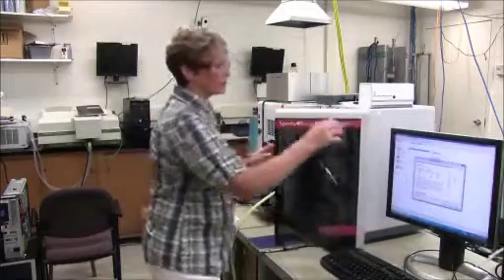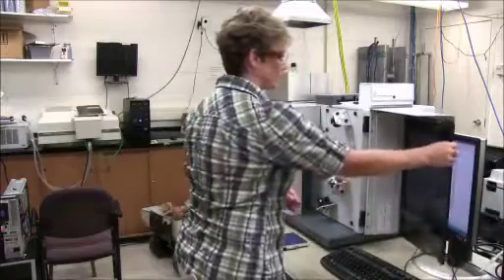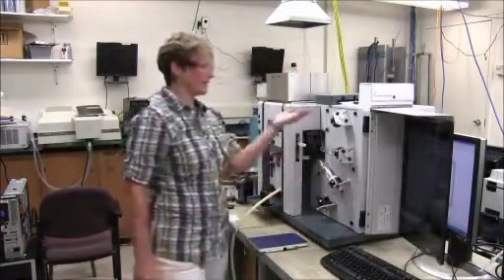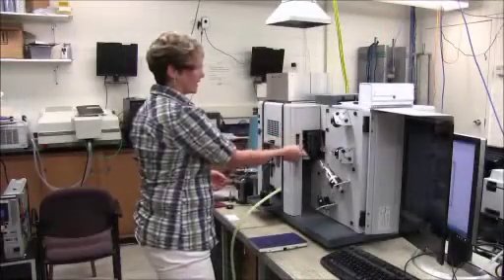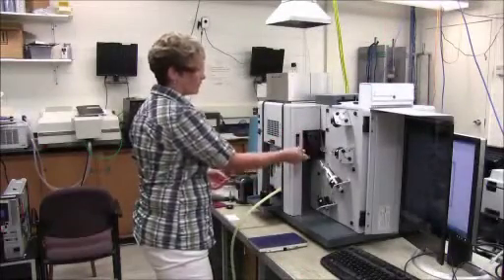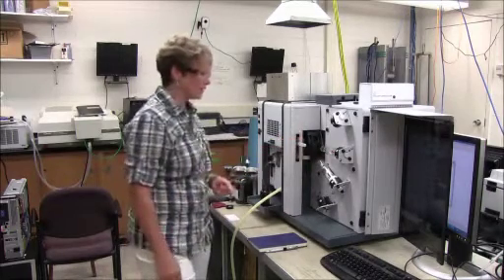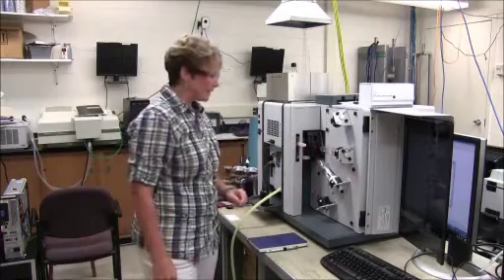For example, and I'll just move that aside so you can see the lamps. The Varian instrument, you're able to look at 4 different lamps at a time, not at once, but depending on where the lever is on this instrument, you can look at lamp 1, lamp 2, 3, and 4. Today we only have 2 that are installed in the instrument, a lead lamp, and this one is copper.